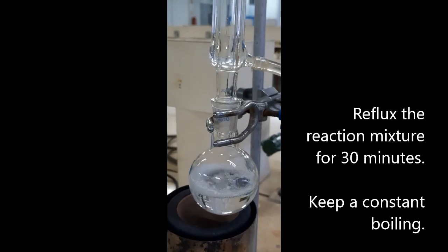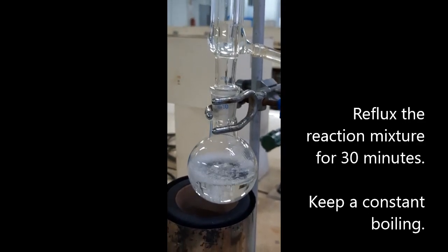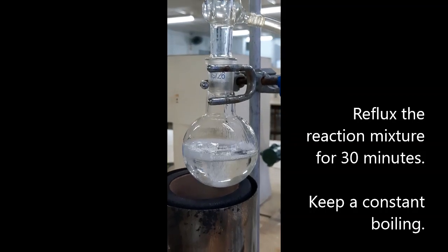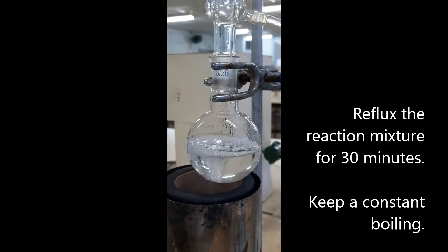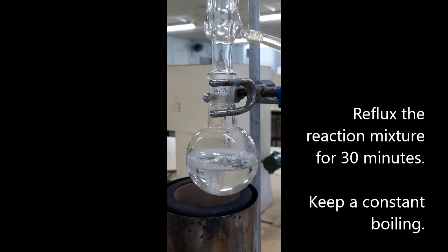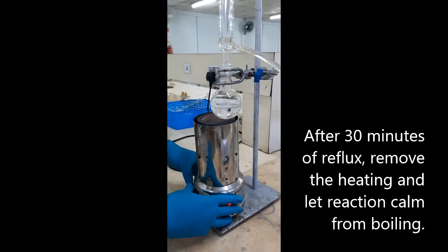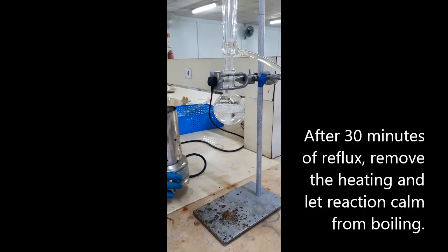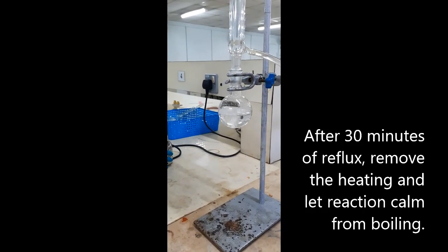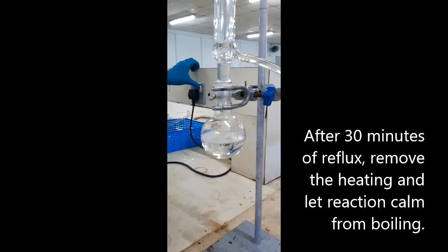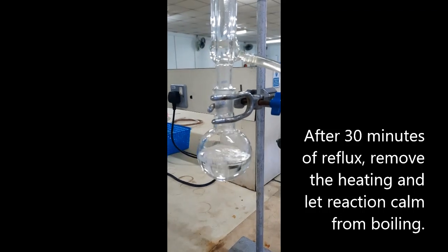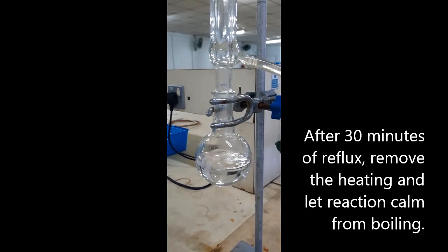Reflux the mixture for 30 minutes. The reaction mixture is left to moderately boil for 30 minutes. After 30 minutes, remove the thermal heater and allow the boiling mixture to settle for 10 to 20 seconds.